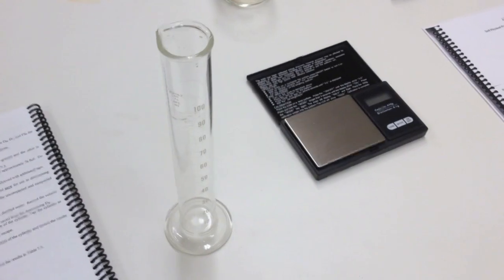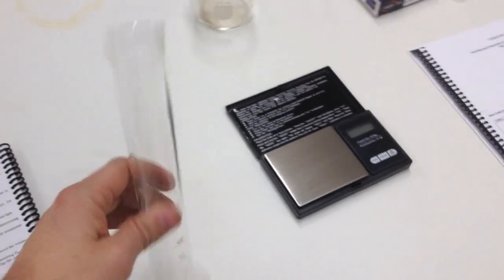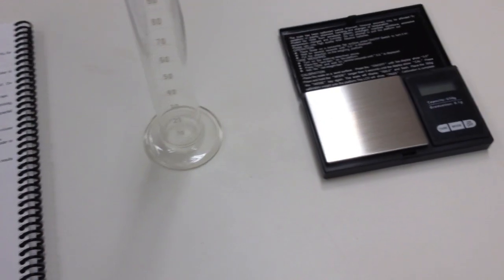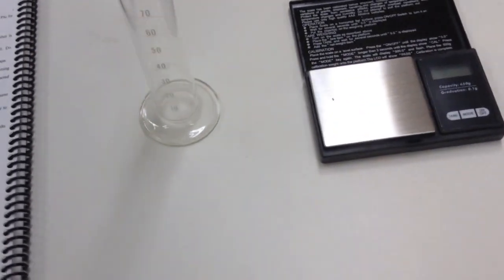In this lab, I'm going to show you how to set up. You only have one of these — this is the graduated cylinder. You can see the markings on the side to determine the volume. This cylinder is measuring in milliliters, and any time we have a milliliter, we can also record it as a cubic centimeter. For these purposes, they are interchangeable in terms of measurement.